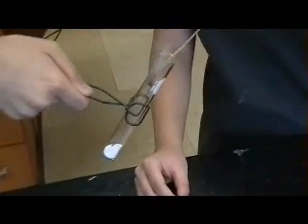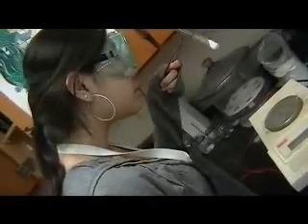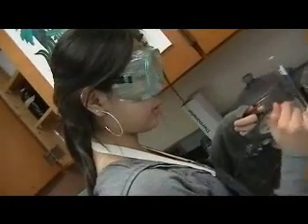To show that the reaction has decomposed and there has been a loss of matter, remass the baking soda and test tube after waiting for it to cool. But before massing, to show that H2O has been produced, if you look carefully at the top of the test tube, you can see that H2O vapor has been collected at the top.